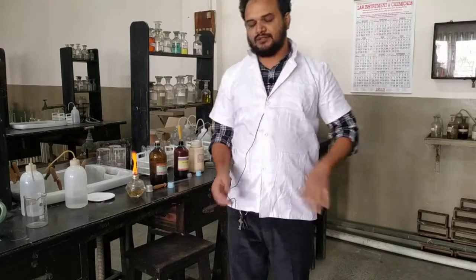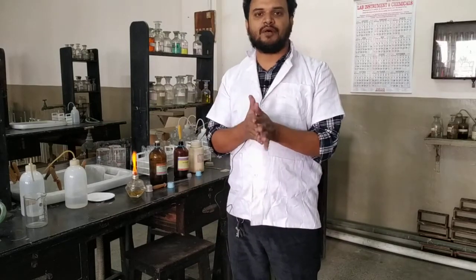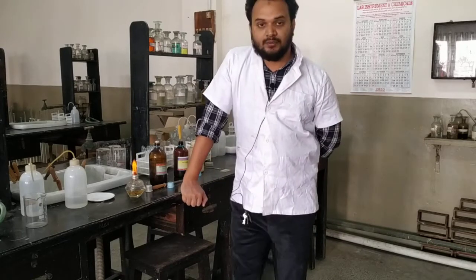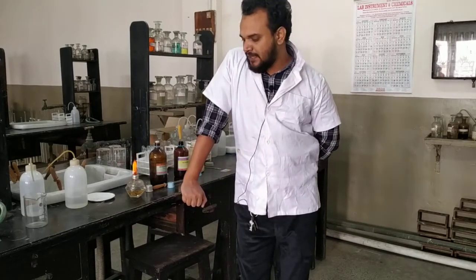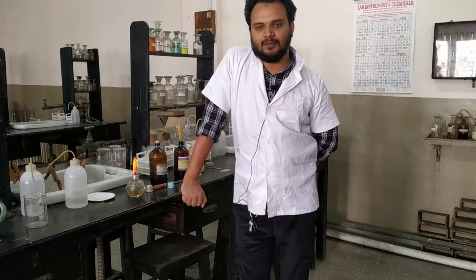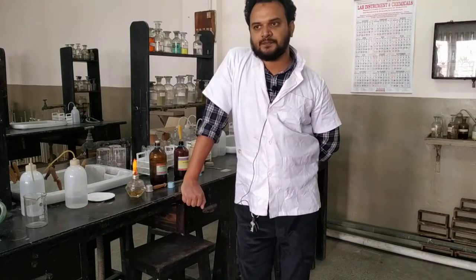Hello everyone, here we are coming back again with another organic compound for our practical lessons for class 12 board exams practical exam. We have already shown you the test for formaldehyde and for acetone.